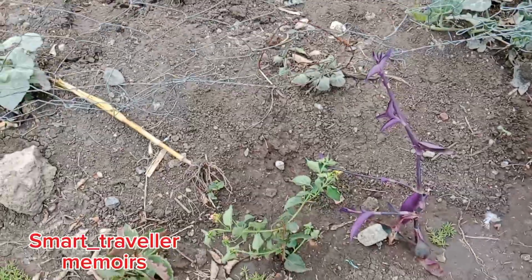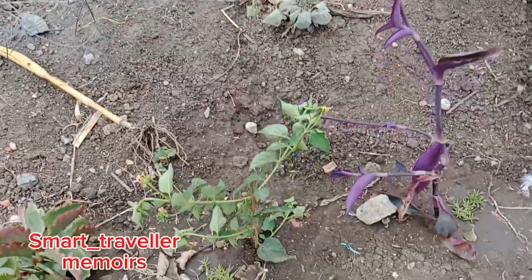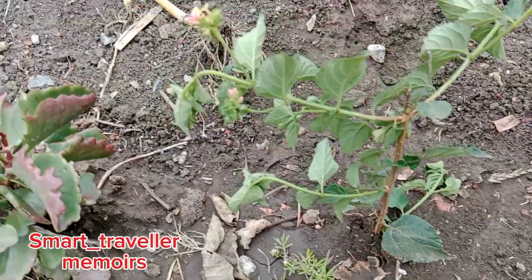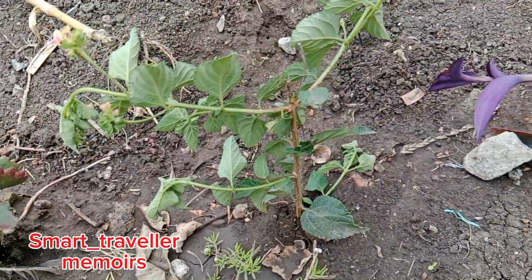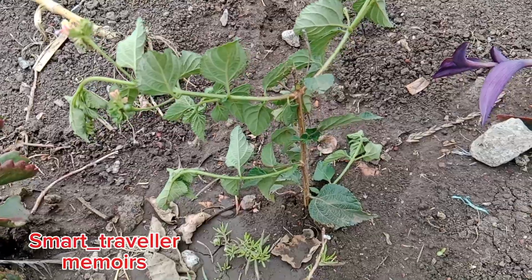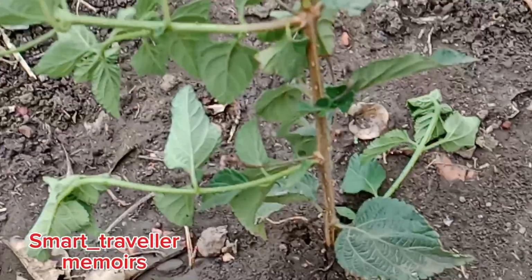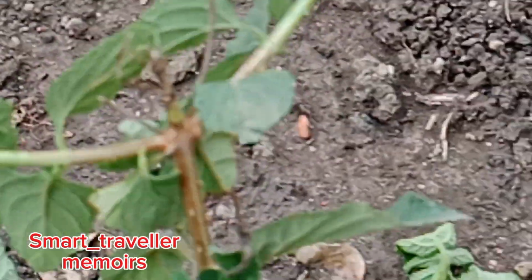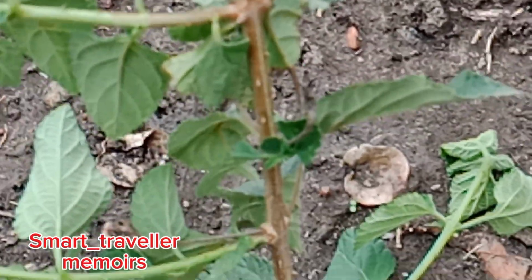In one of the questions for this practical, we'll be having these two plants as specimens. The first plant is that one, a twig of that plant there.